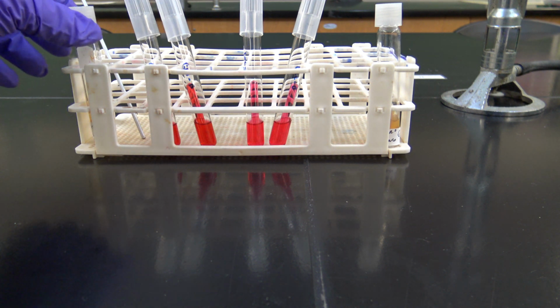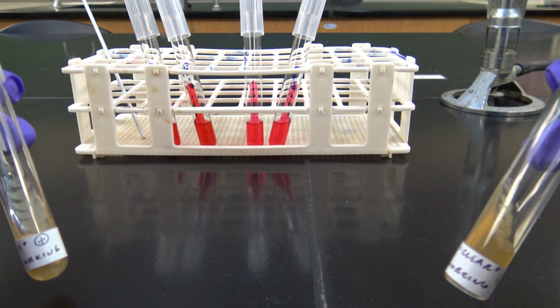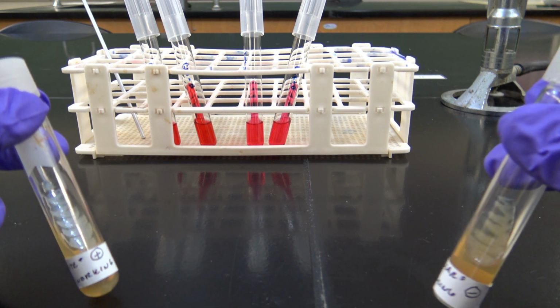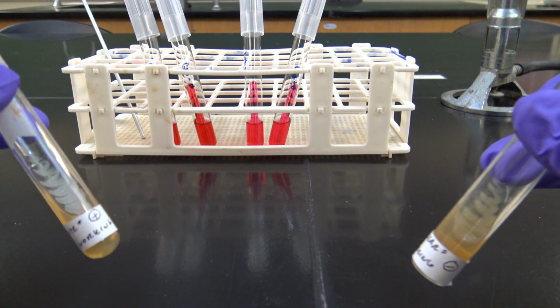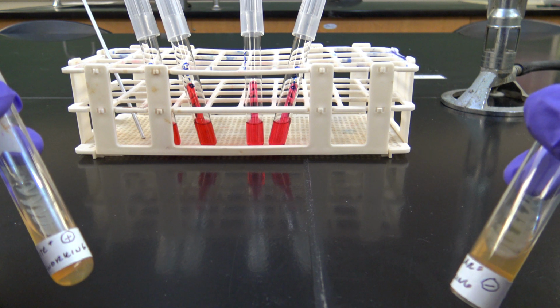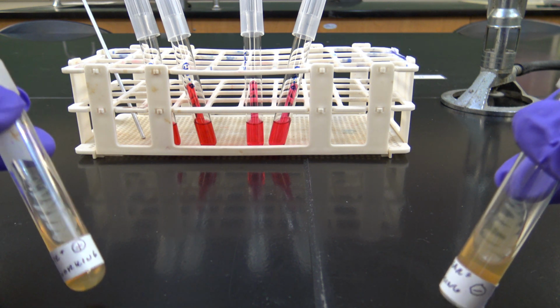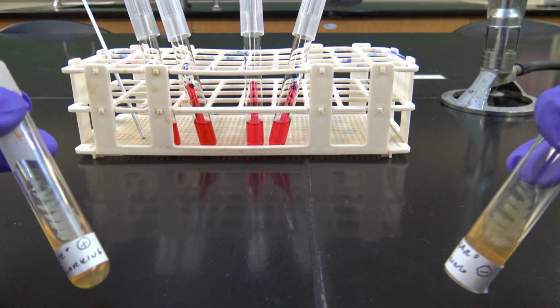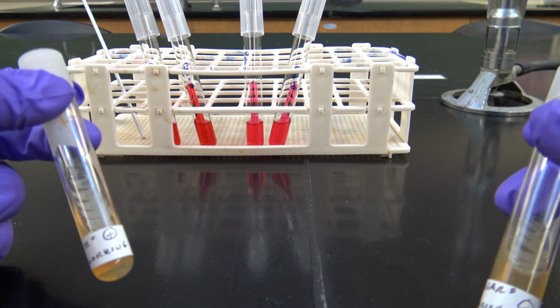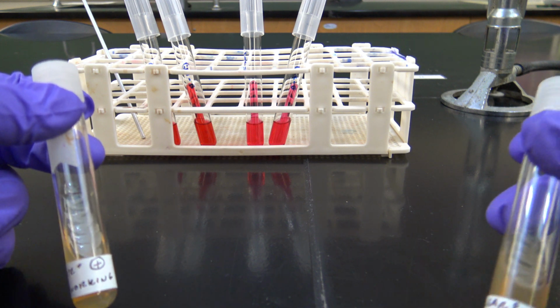In the last video, if you remember, we put the separated species each onto different reserve and working slants. So that's what I'm using here, the working slants, as opposed to an old Petri plate that has been growing and aging. We want to keep using fresh cultures for all of our tests because we'll get the best, most reliable results from those. So we made reserve and working slants. I'm using the working slants here.